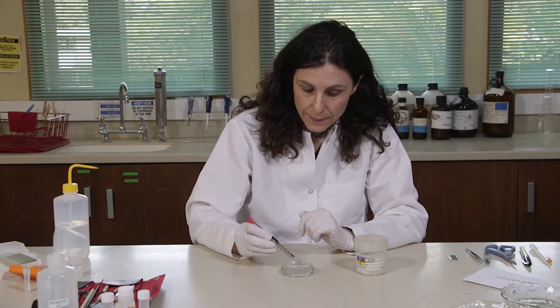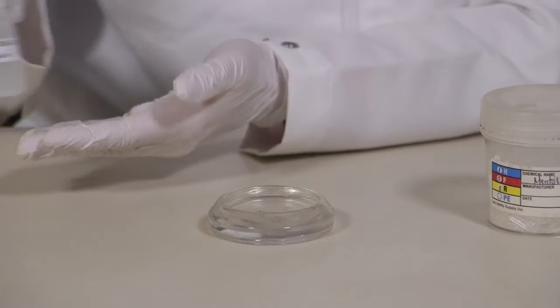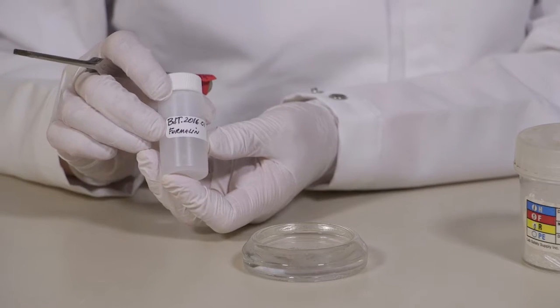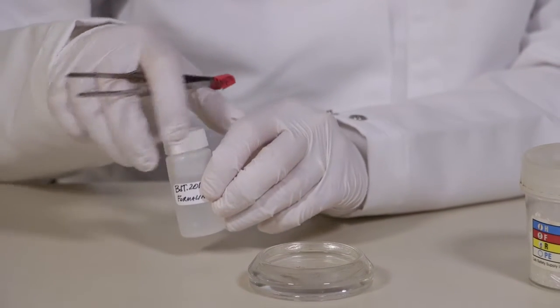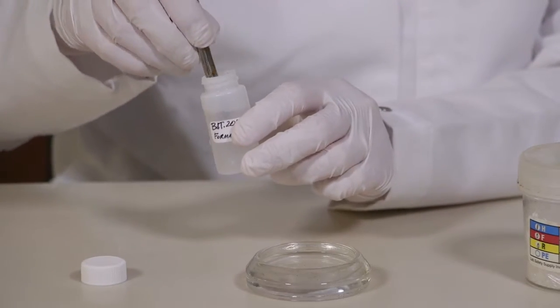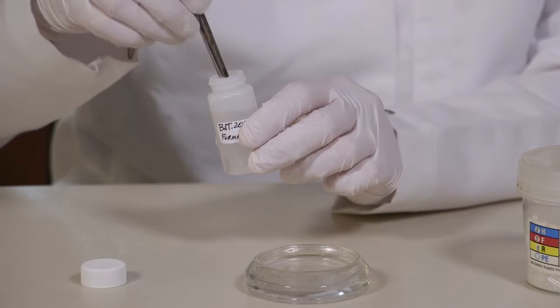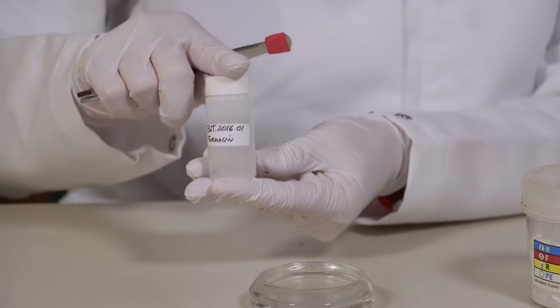This can take up to half an hour or so. Once you're sure that the polyps are completely relaxed, you can now preserve them in formalin. I've already prepared the vial with a label — of course you can label the vial as it is more convenient for you. You can take the colony and drop it in the formalin. Your vial is now ready.